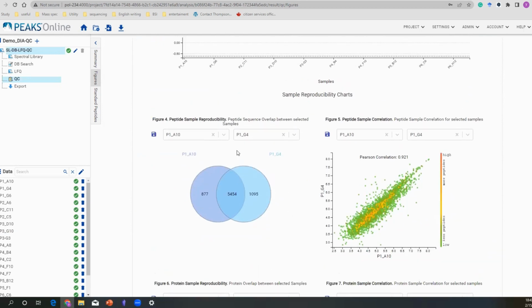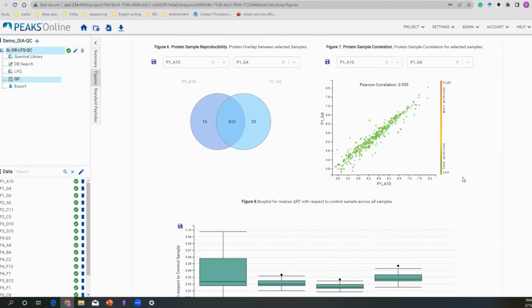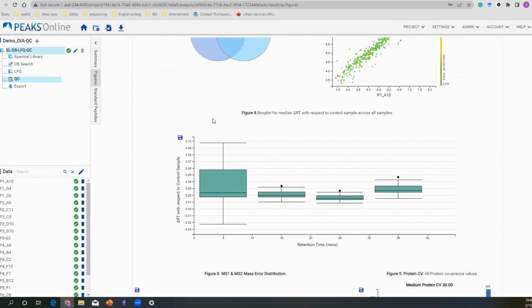For example, in here, a Venn diagram: pick any one you want to monitor. It will update automatically for you. And as for the Pearson correlation chart, you can also pick any two that you want to check. Very convenient to use. So in here, we give out a box plot of median delta RT. You can check your peptides for any major retention time shifting compared to your control sample.